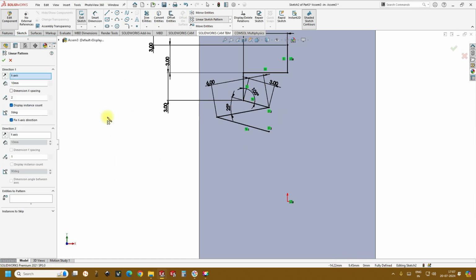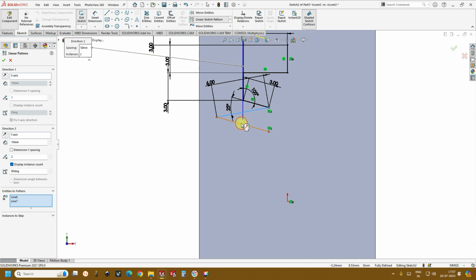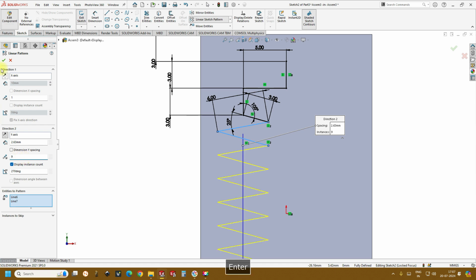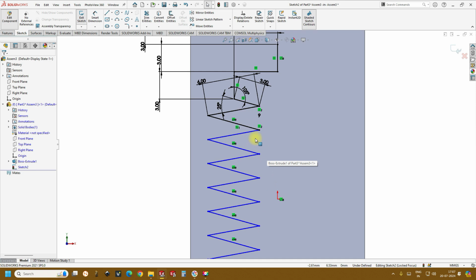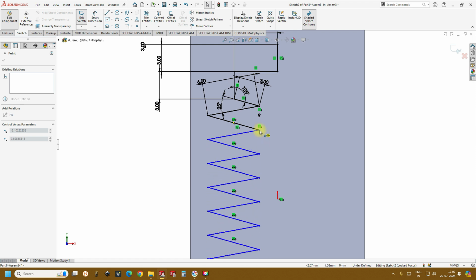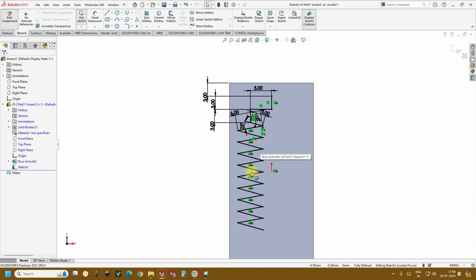Okay, come back, linear sketch, select the entities and give the distance as 2.63. Okay, just reverse the direction. If you can see there's an interjunction here, they are coincident, or they might not be coincident. We'll see once we create the number of instances. So we'll increase this to 9, click OK. Now if you see, this is blue in color, so these are easy to move. So you just hold this and connect to this. That is how it completely becomes a fully constrained model.